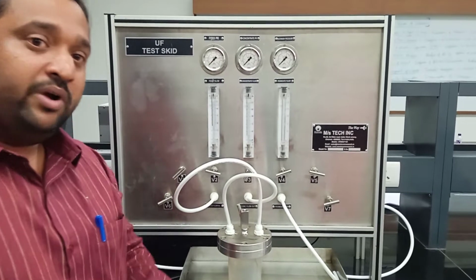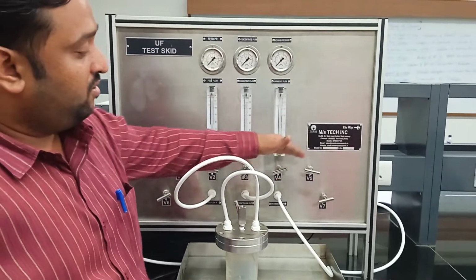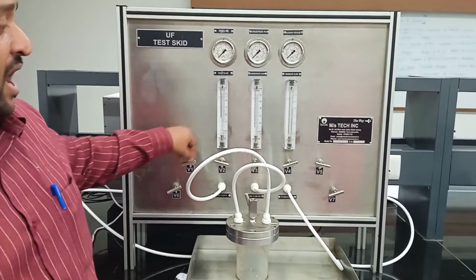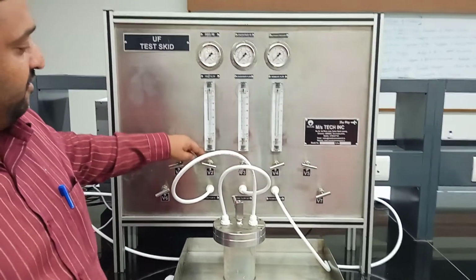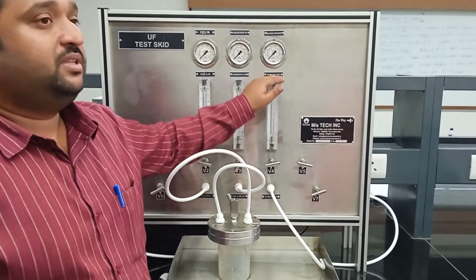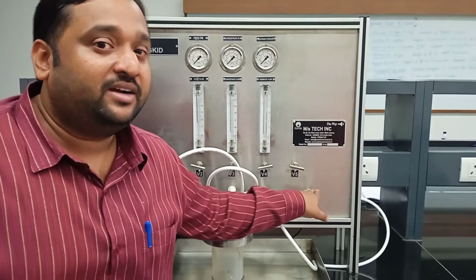Let me explain the process of filtration study. Before that, I am going to introduce the different valves. We have V1, V2, V3, V4, V5, V6 and V7. V1 and V5 are called bypass valves. V2 is for the feed flow rate, V3 is used for the concentrate flow, and V4 is for the permeate flow. V6 and V7 are the drain valves to empty the tanks.